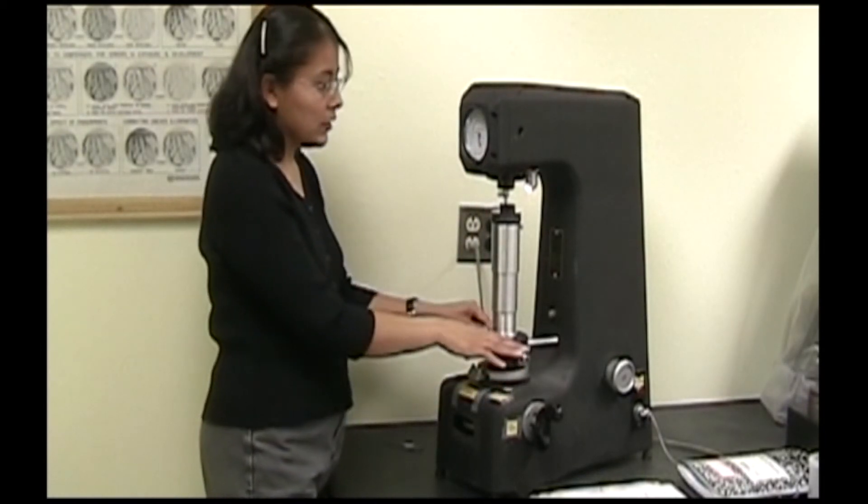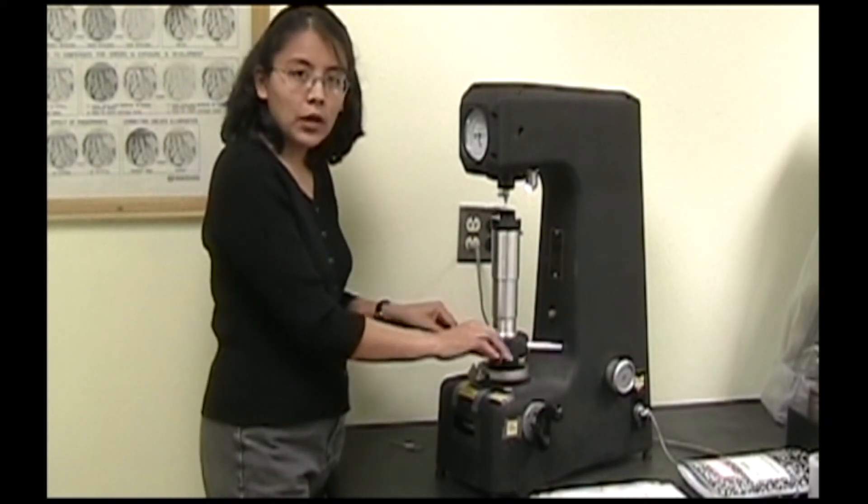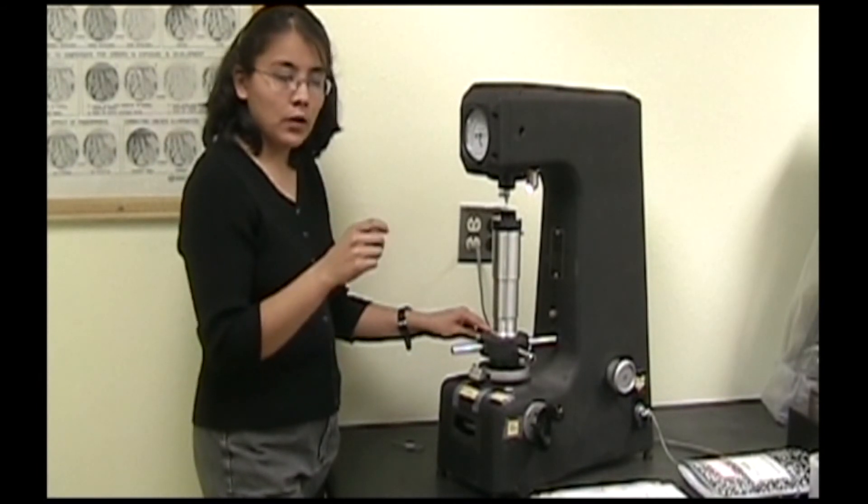When you finish the test, you can reposition this specimen. Make sure that your indentations are at least four times the width of the diameter of the indentation apart.